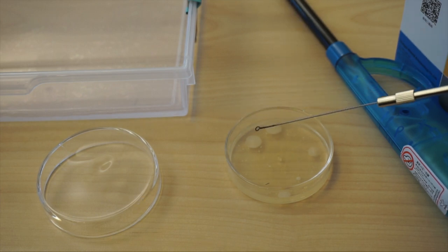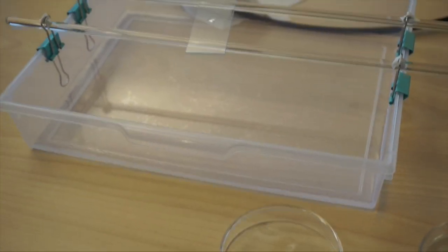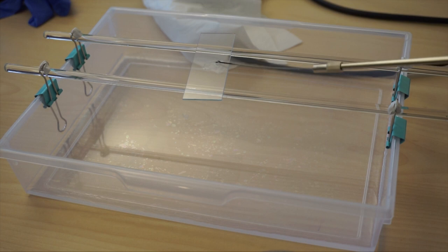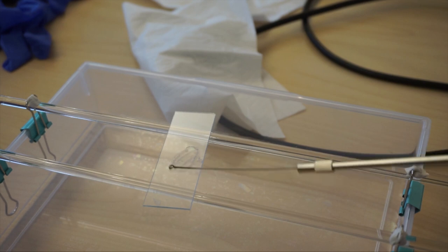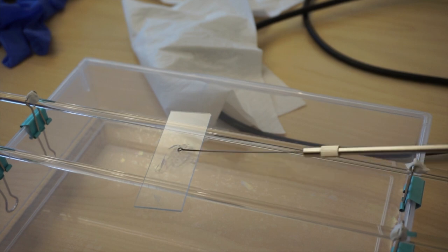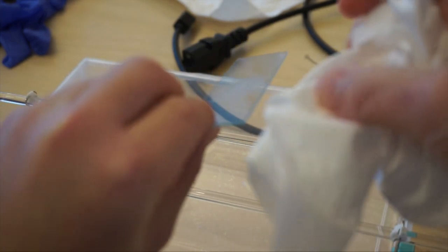Take your bacteria plate. Open it. Make sure you take the precautions because bacteria may be pathogenic. Place it in a clean part of the agar without the bacterial colony to ensure cooling of your loop because it's really hot right now. You might hear a sizzling sound. That's normal. Take a single bacteria colony like that. Just touch it with your loop. And then turn back here. You will just smear the bacteria like that.